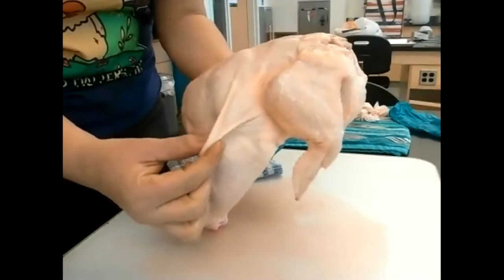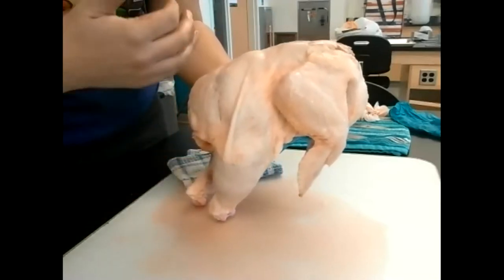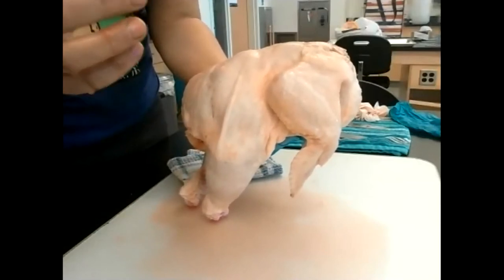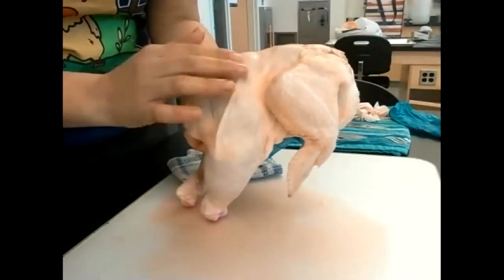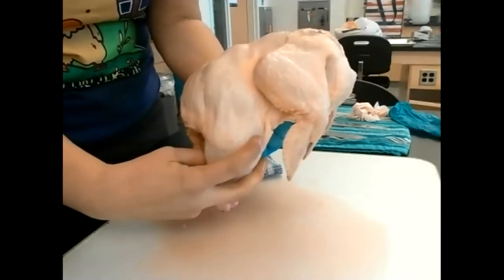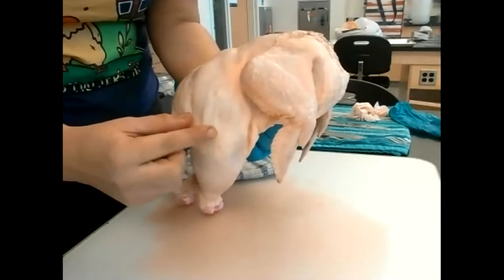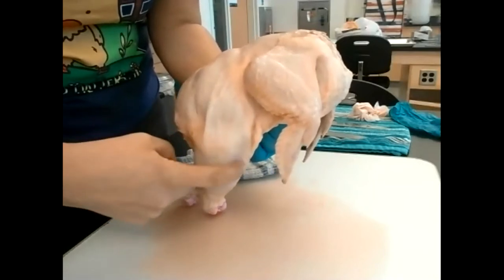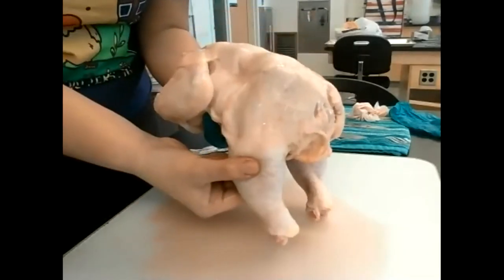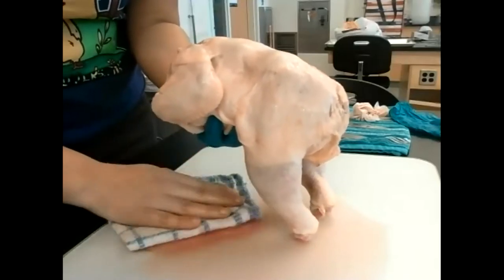The skin is on the lateral side. If you have plain legs in a package, look for the skin — the skin is on the lateral side. The knee, the bendy part here, faces anteriorly — it faces the head. So the skin is on the lateral side, the knee is pointing to the front, which tells us which leg is right and which is left. I'll show you this again when I remove the leg from the chicken.